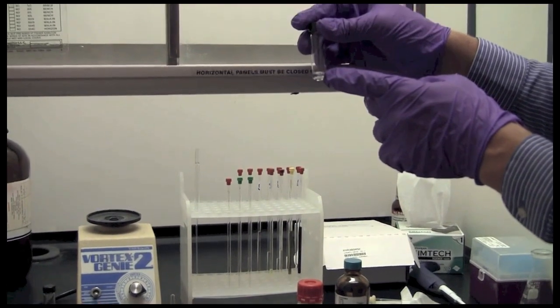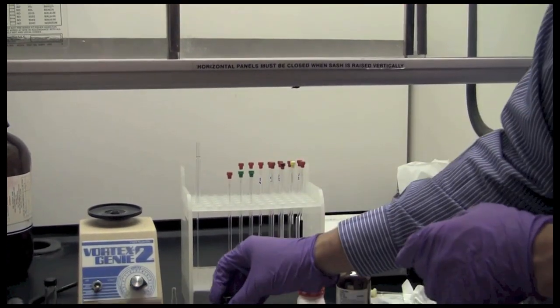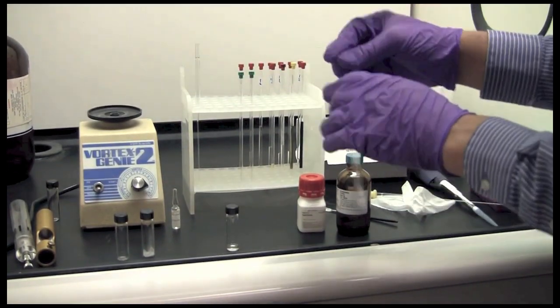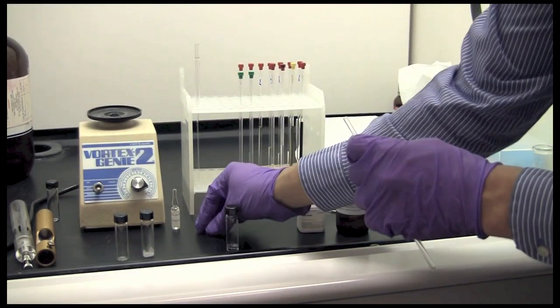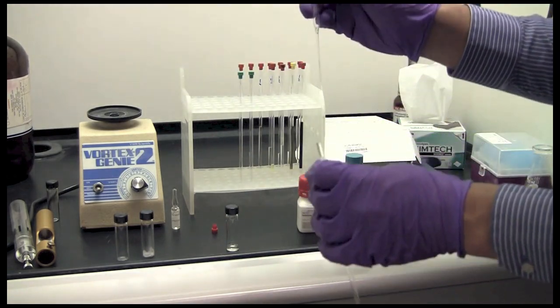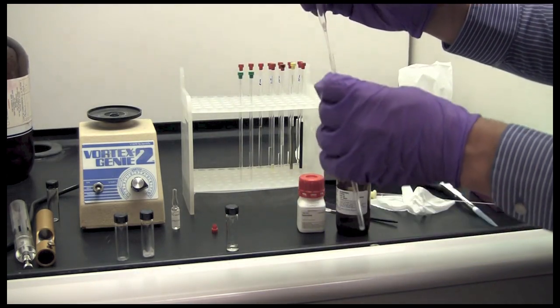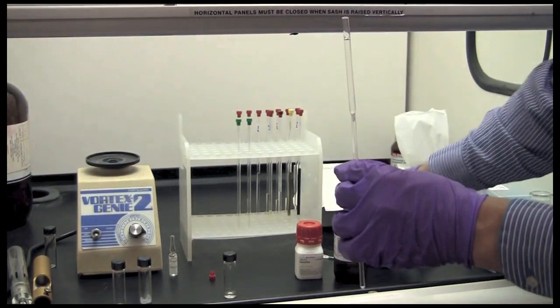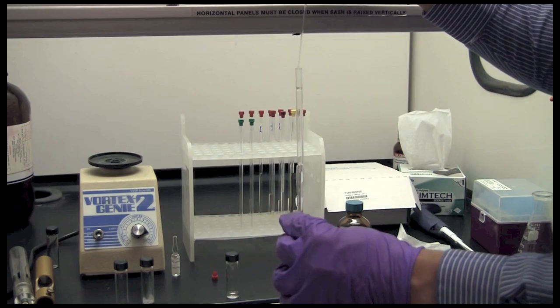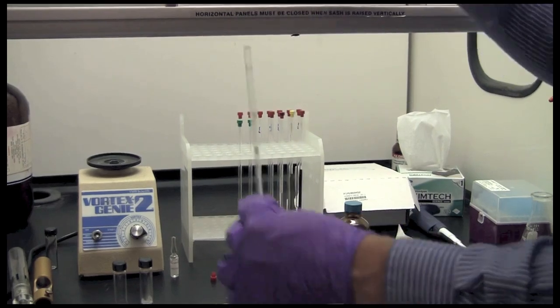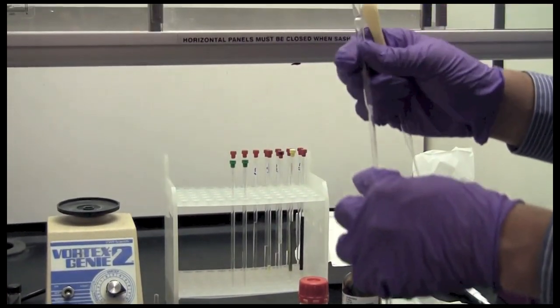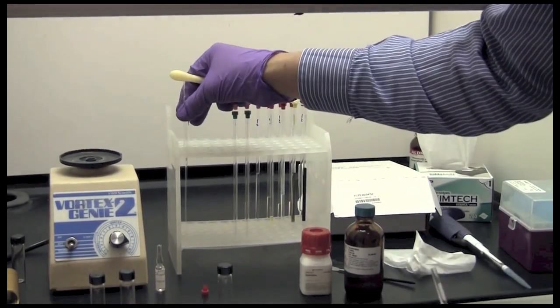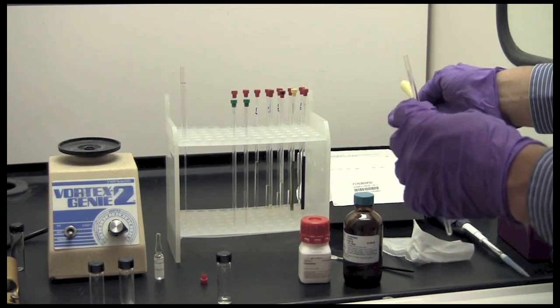If there still are solid particles in the sample, one way to avoid getting this into your NMR sample is to use a simple glass wool filter which can be done like this. So you put a small amount of glass wool or other filter material and then you would pipette your sample through here into the NMR tube. If your sample does not have solids you can avoid this, but just be aware that solids will negatively affect the quality of your sample.